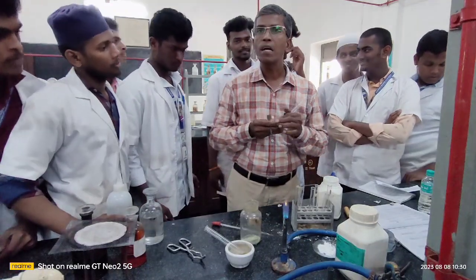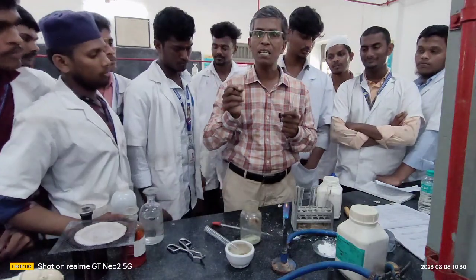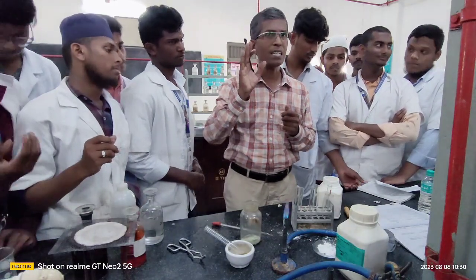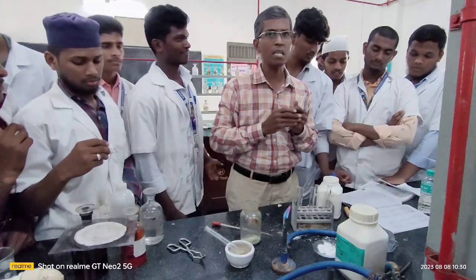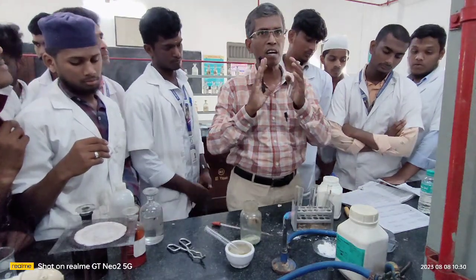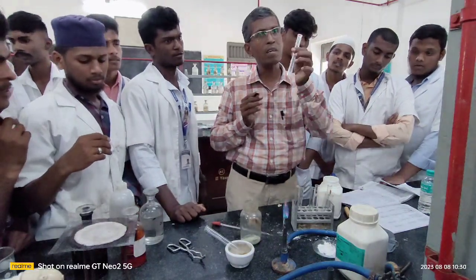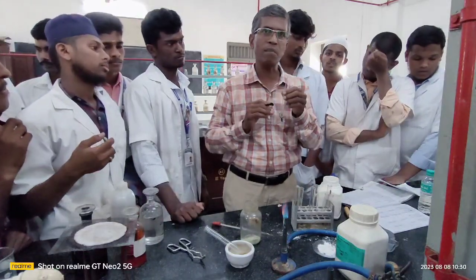Please listen. I am going to show you how to carry out the confirmatory test for the presence of carbohydrate. There is an important test to confirm the presence of carbohydrate in your given organic compound. Once you follow the procedure carefully, you will finally get a beautiful silver mirror on the surface of your test tube.